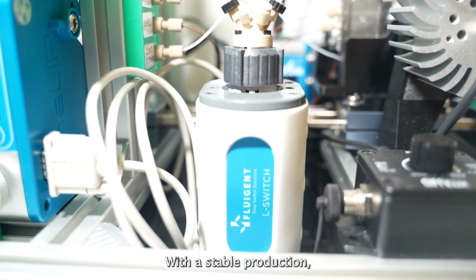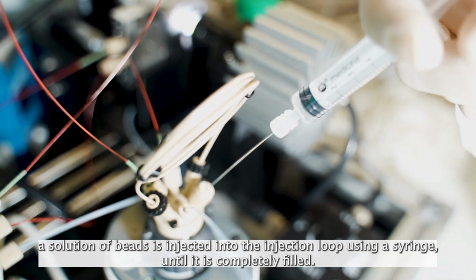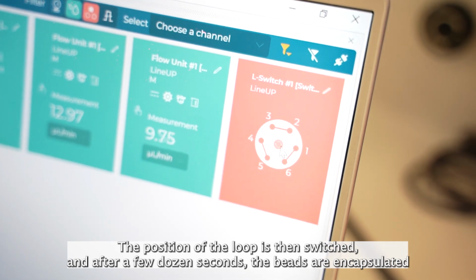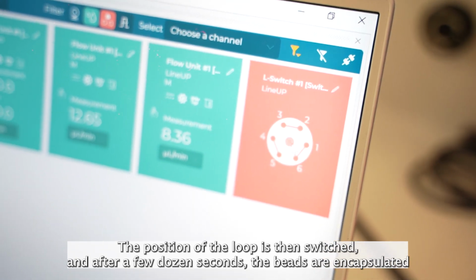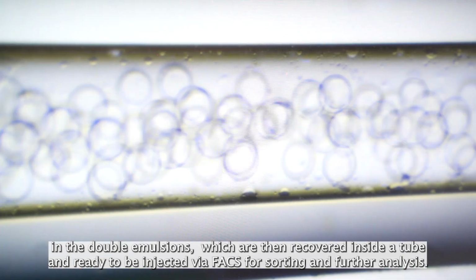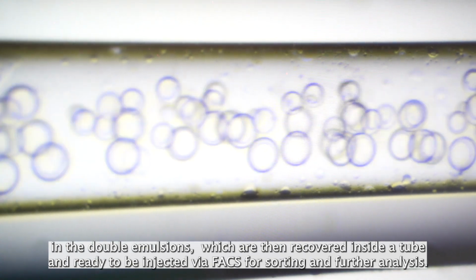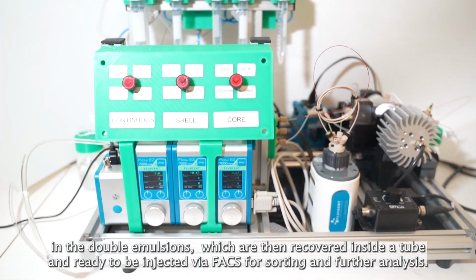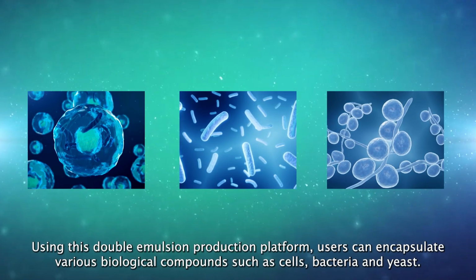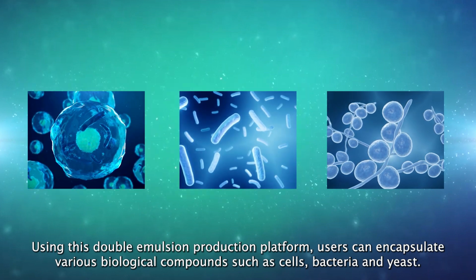With a stable production, a solution of beads is injected into the injection loop using a syringe until it's completely filled. The position of the loop is then switched, and after a few dozen seconds, the beads are encapsulated into the double emulsions, which are then recovered inside a tube and ready to be injected via FACS for sorting and further analysis. Using this double emulsion production platform, users can encapsulate various biological compounds such as cells, bacteria, and yeast.